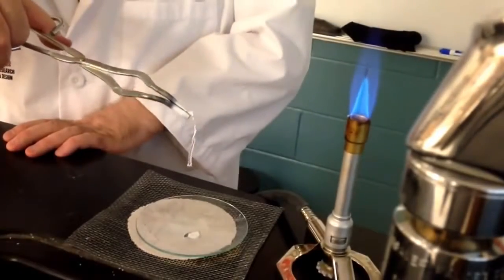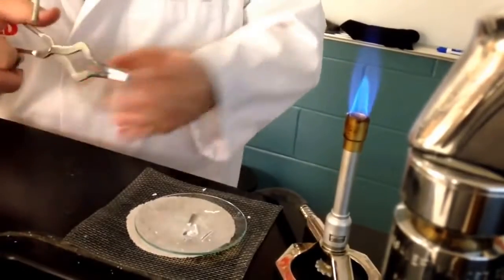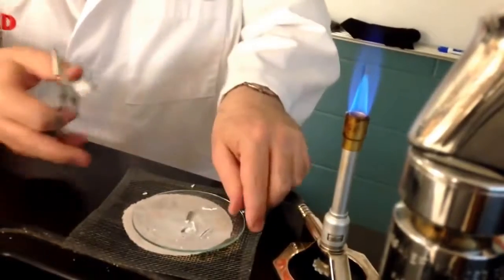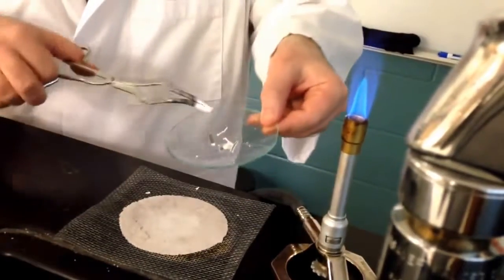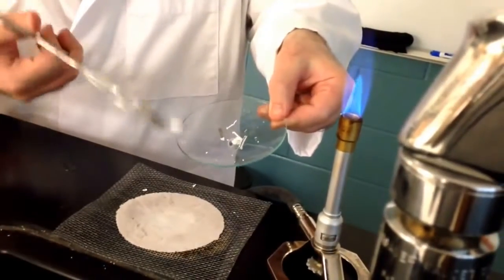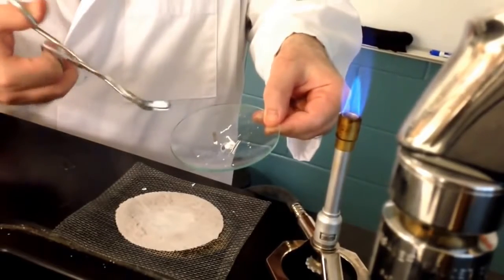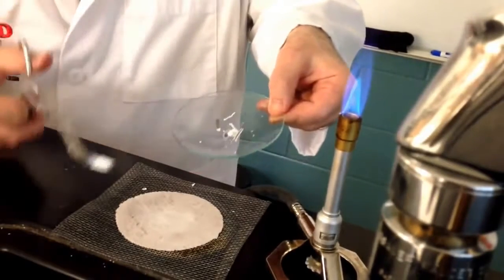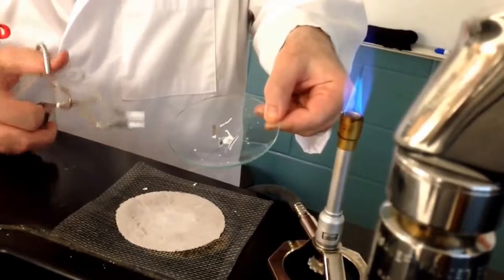And now I can release it. And you see how it just crumbles. And we have some magnesium oxide. That's why the crucible tongs, the tips are now white. Magnesium oxide is a very soft white substance.